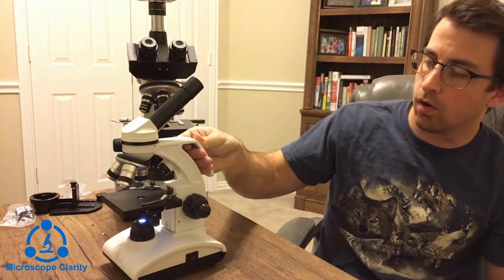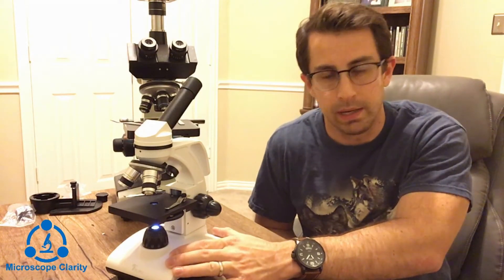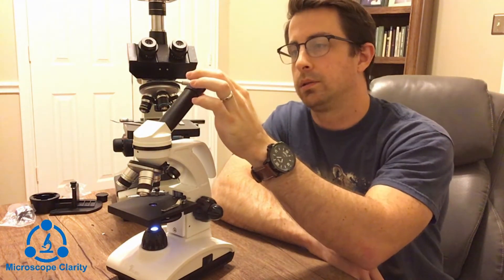Above the nosepiece you have the body, which contains the optical pieces — also called the head. On the side here is called the arm of the microscope; if you were carrying it you'd carry it by the arm. The flat bottom is called the base. So the three structural components are the head, the arm, and the base. Then you have the eyepiece tube holding the eyepiece, which is what you actually look through — these come in 10x, 25x, even 30x. Magnification is calculated by multiplying the eyepiece magnification by the objective magnification currently in place.